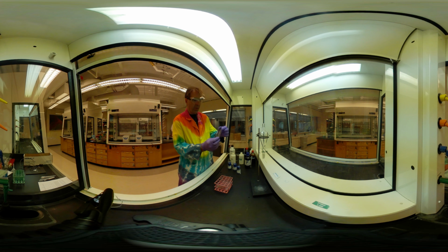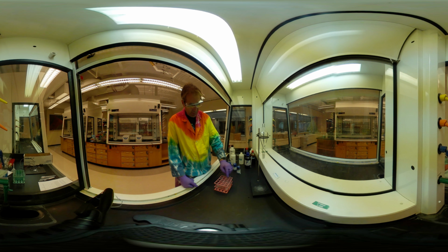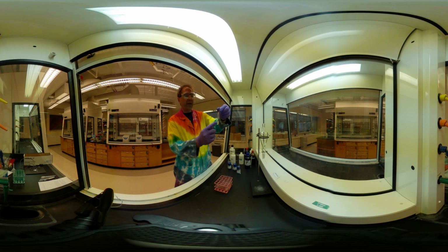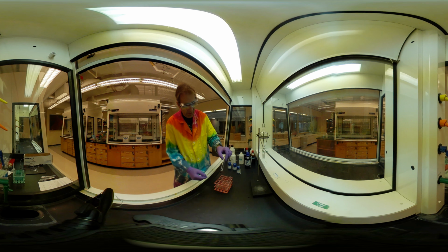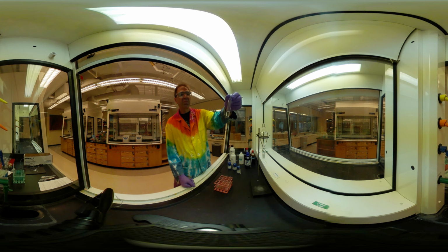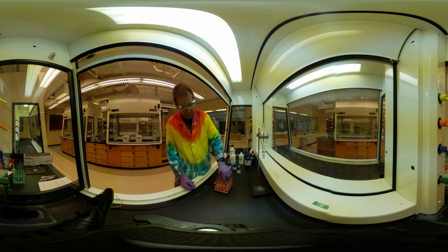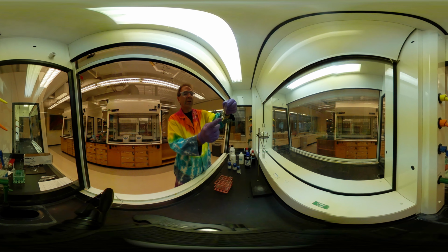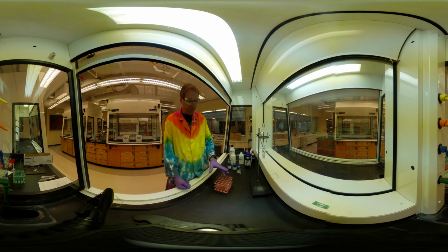Next one we're going to look at is the benzoic acid. Benzoic acid in water, not soluble. Big old chunk of it on the bottom there. Then we have benzoic acid in HCl, also not soluble. There's a chunk on the bottom, and we have a couple pieces floating in there. Then we have benzoic acid with sodium hydroxide, soluble. Everywhere where I've mixed it, it has dissolved. And then we have the methylene chloride, also soluble. Okay? So the benzoic acid was soluble in the sodium hydroxide and the dichloromethane.